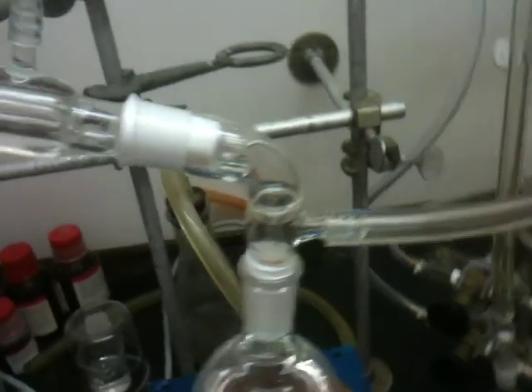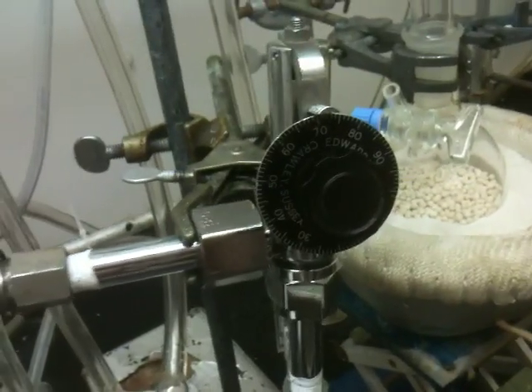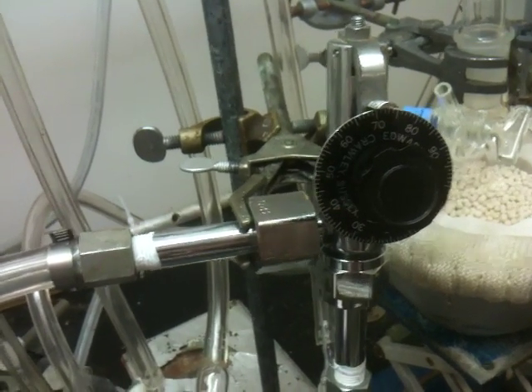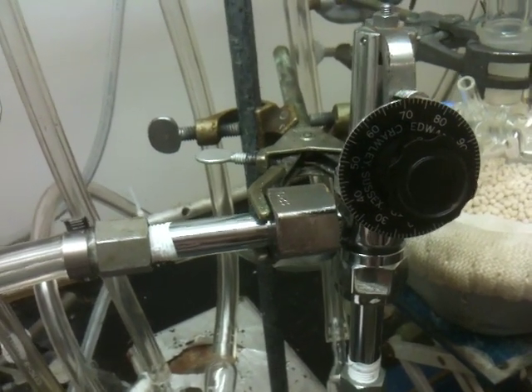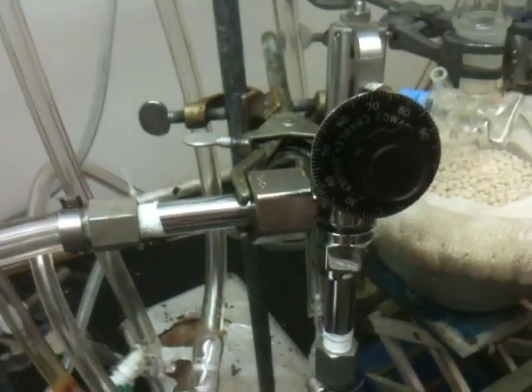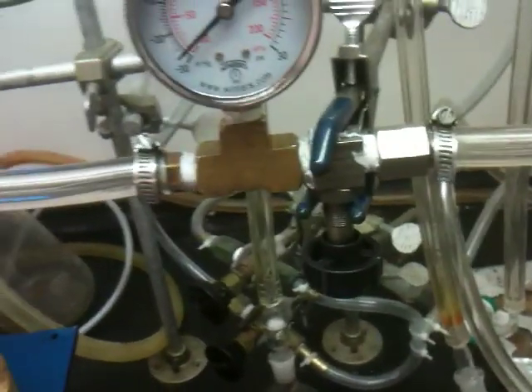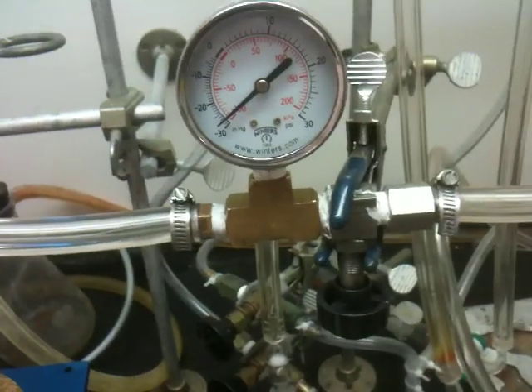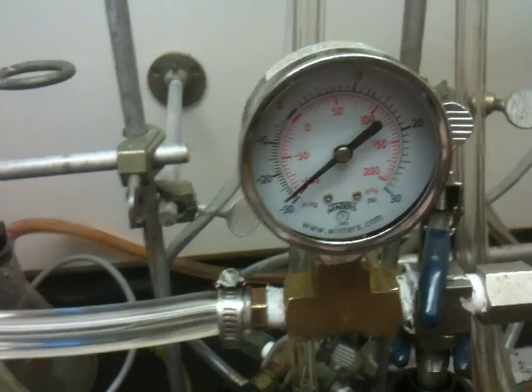Here's the setup, connected to the high vacuum. I have a control valve because I'm getting vacuum pressure from the vacuum pump — it is too strong — so this little knob here is to control the vacuum pressure. And here's the second valve; you can shut down the vacuum if you need to. And here is the gauge.